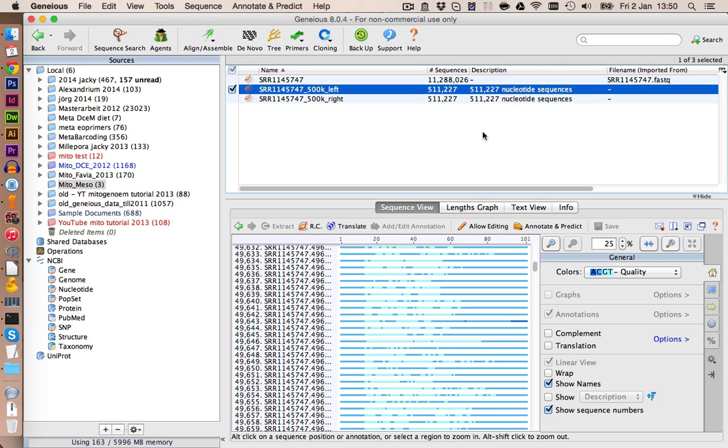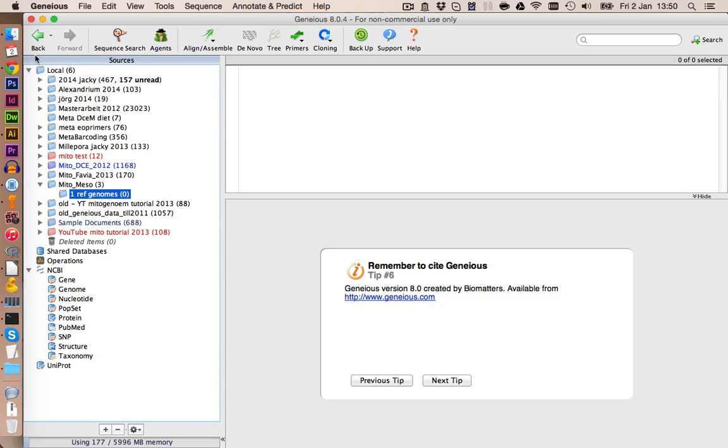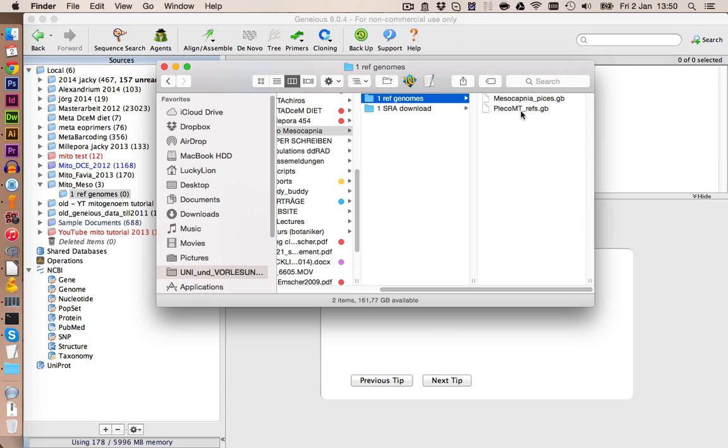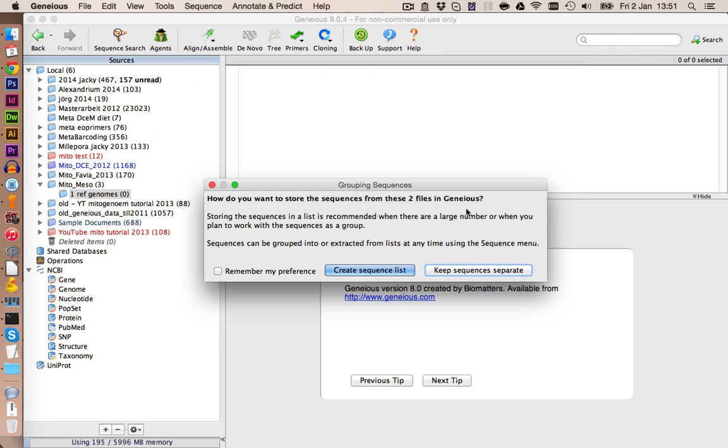A few videos back we downloaded some reference genomes of other stoneflies, and we're first going to start to import those into Geneious. Let's make a new folder and call this one reference genomes. We can import the data by drag and drop. Geneious will ask us if we want to have a sequence list, but we should keep them separate so we can work with each genome individually.